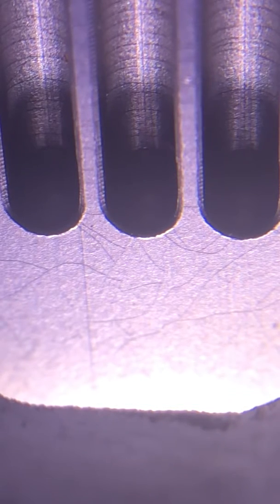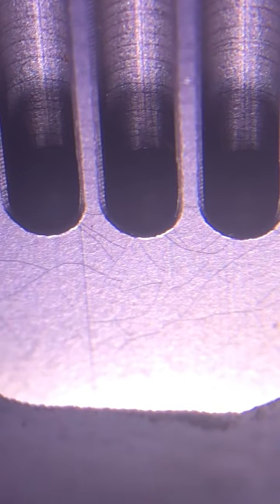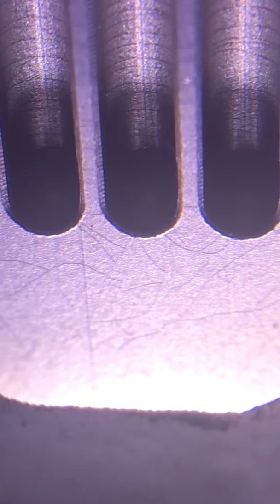I thought I'd show you what a melting point looks like. I have DigiMelt and I set the initial temperature to 116 degrees. I have a sample of benzoic acid and benzoic acid melts at 122 degrees.